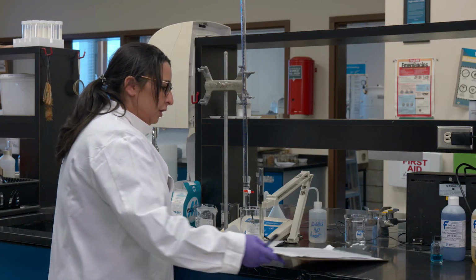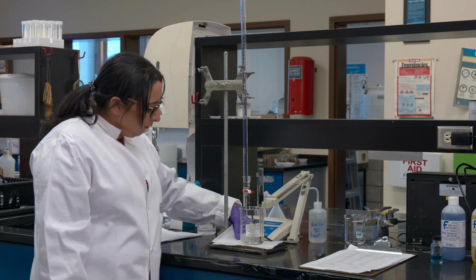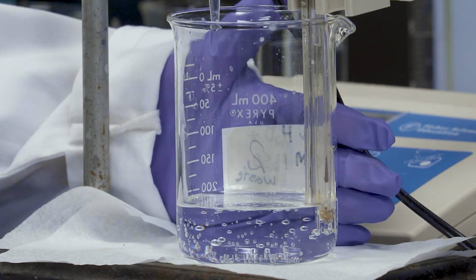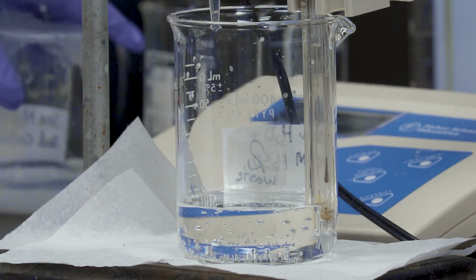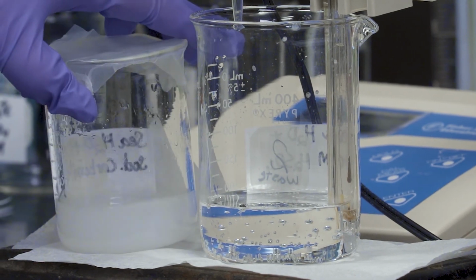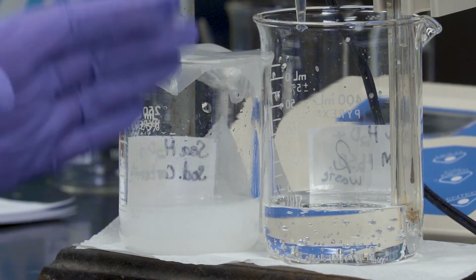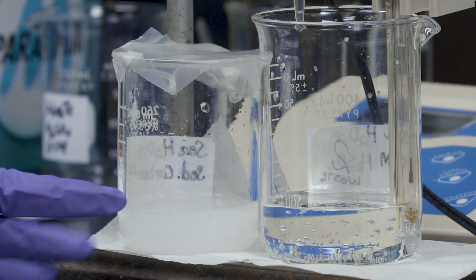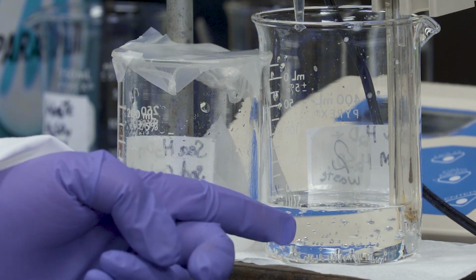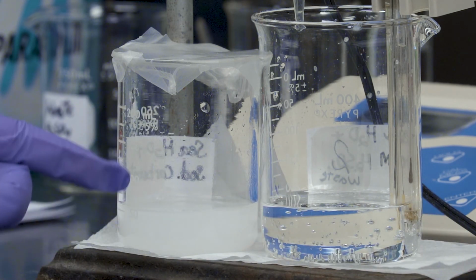Okay everyone, so this is our final reading. I'm at 2.64 and again I will zoom in. So this is the final solution we were looking forward to. And to remind you again, the equation that we're going to learn started with the carbonate. In between we were bicarbonate. That's when the first equivalence point happened. Remember when this was not this bubbly but still clear, and this is when the CO2 happened. So this was the whole idea, the whole game of going from here to here.